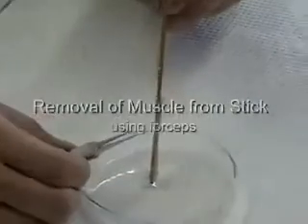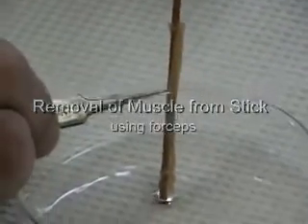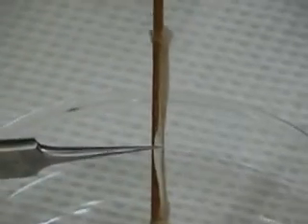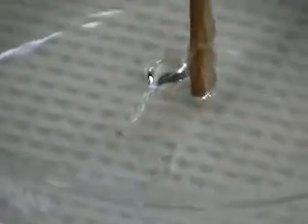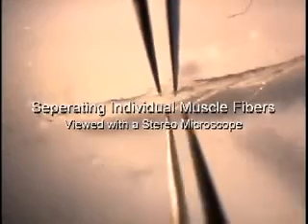The delicate muscle is supported by a wooden stick. The muscle fibers can be teased apart from each other using fine forceps. The investigator is separating several muscle fibers and will then isolate a single muscle fiber using a stereo microscope. After isolation, individual muscle fibers can then be viewed at higher magnification using a compound microscope.